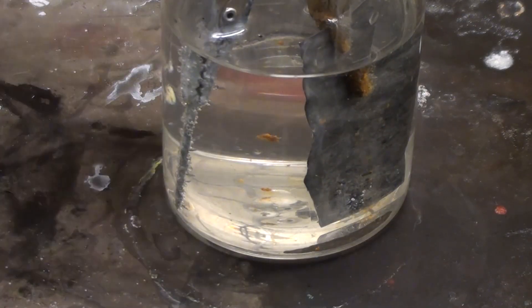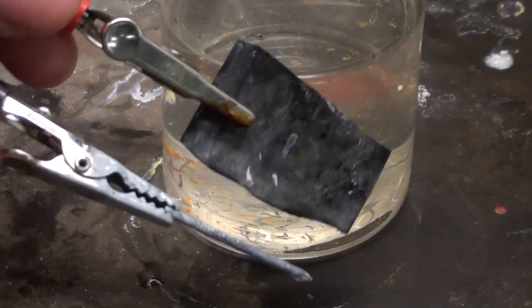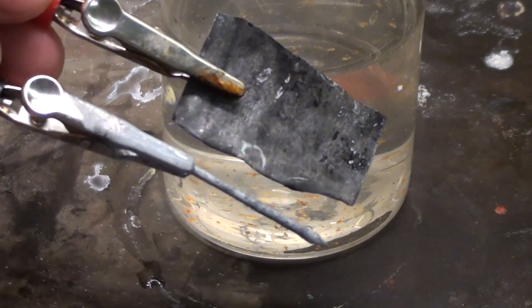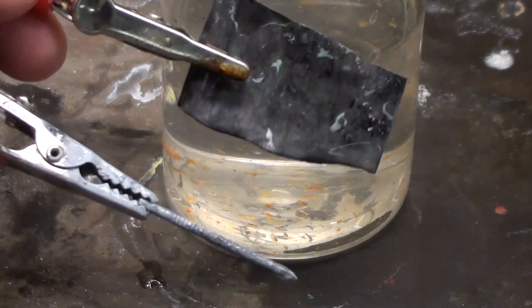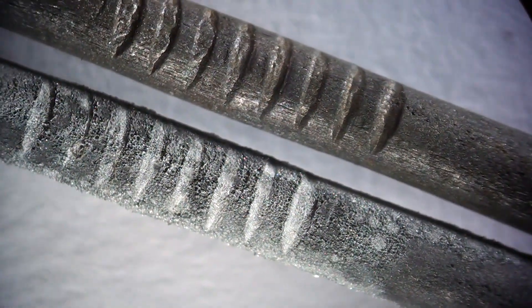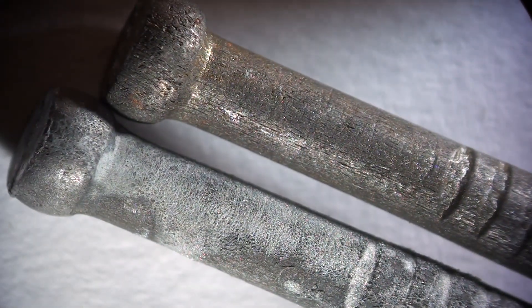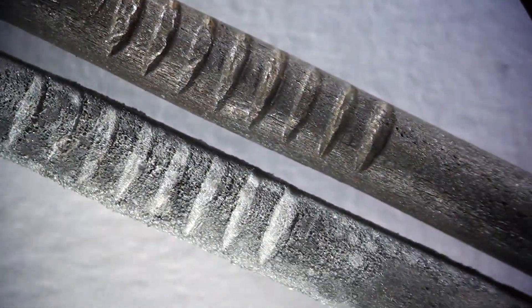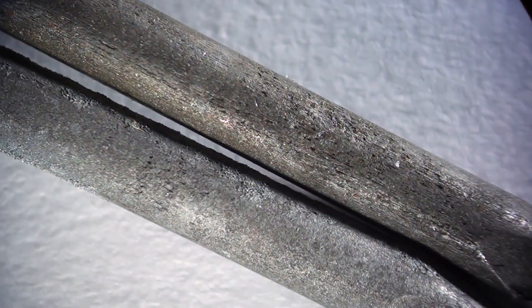After about a minute, turn off the power and remove the electrodes. You can see here the distinct coating of zinc metal on the surface of the nail — this is what we call a galvanized nail. Now let me bring it over to the microscope. Here are the two nails: the galvanized one at the bottom and the untreated nail at the top. The galvanized nail has a rough coating of tiny zinc crystals that give it a slightly lighter appearance compared to the untreated nail. The coating is not perfectly continuous with the whole nail, but it doesn't have to be.